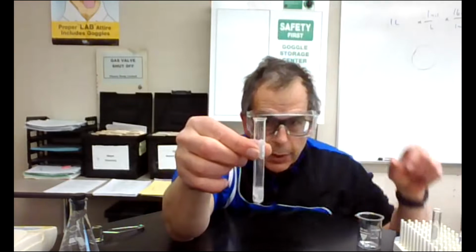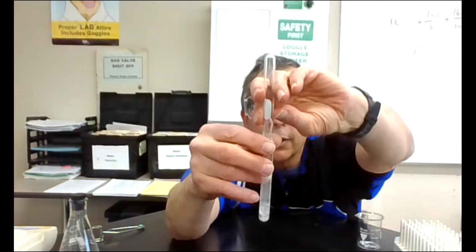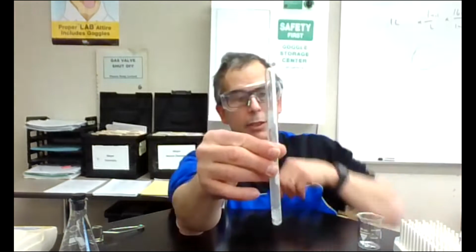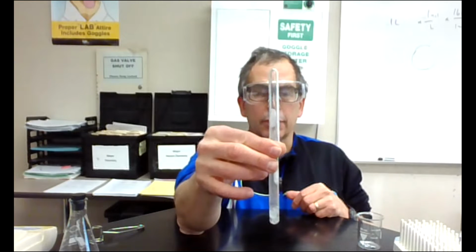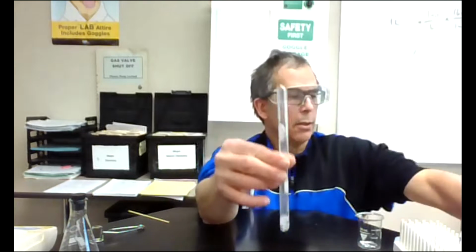And I think you should probably see some pretty good bubbling coming up right away. So there's bubbling coming up. Okay, if I feel down here, this is getting pretty warm. Okay, this reaction as well. So I got this reaction going. I'm getting some bubbling. And as that bubbles, I'm going to light a wood splint.